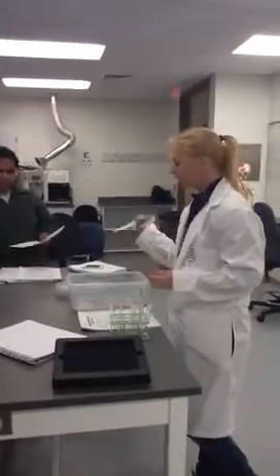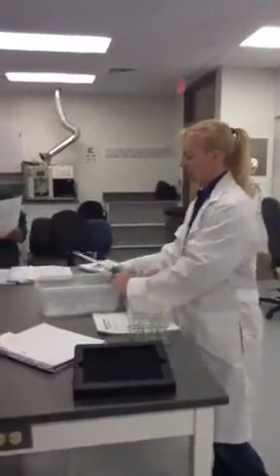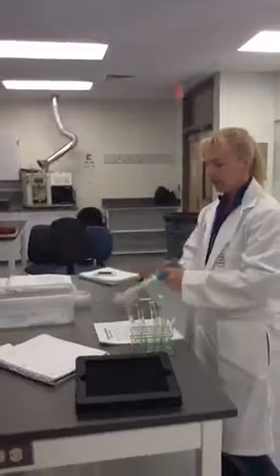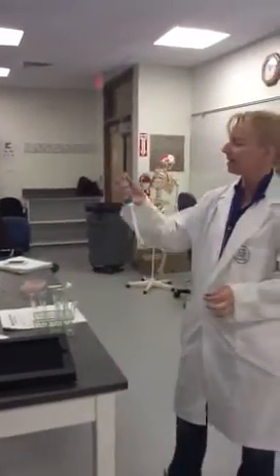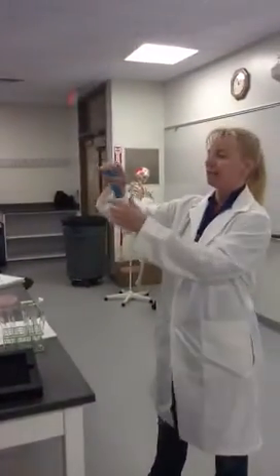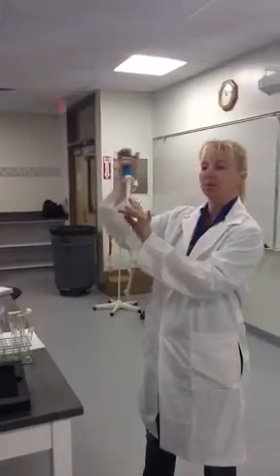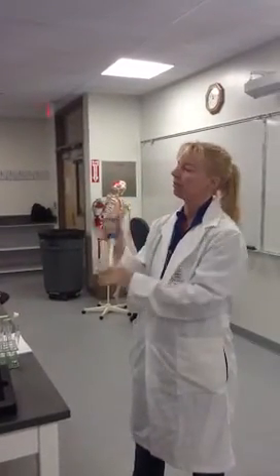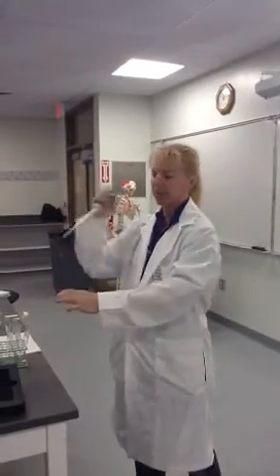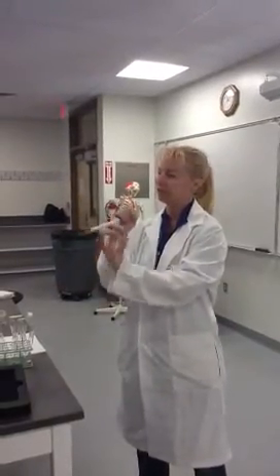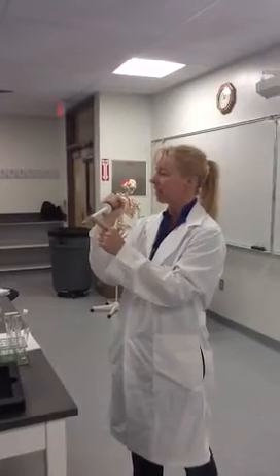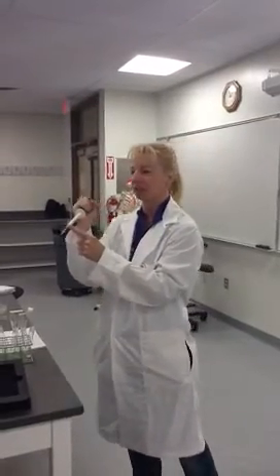In here we're going to use these models that I've created, but what you can do with these pipettes, this is one type of pipette here. You put the sterile tip on it. These are obviously not sterile at this point. What they would normally do is come in a container and you would stab the pipette into the tip so that your hands never have to come into contact with it.